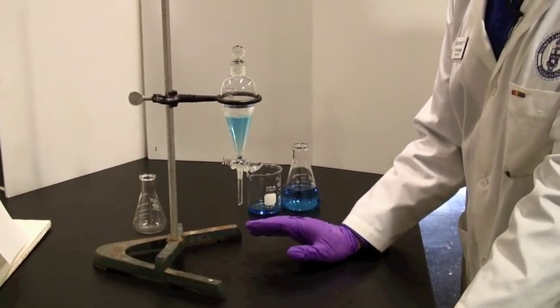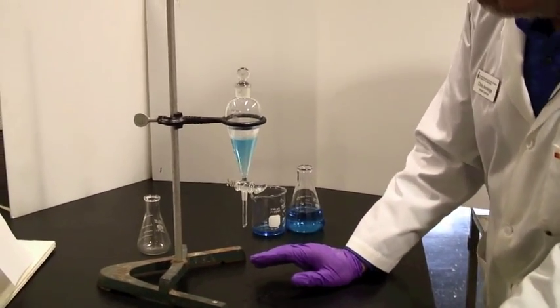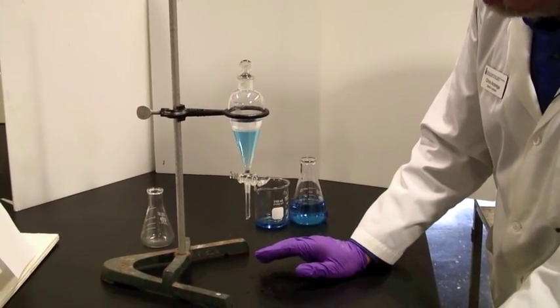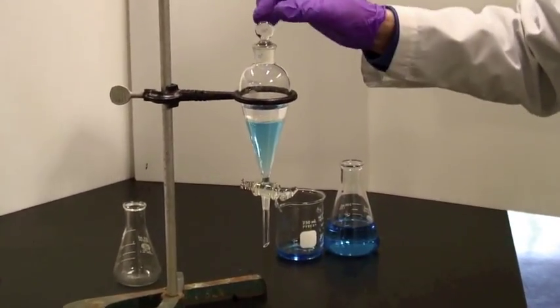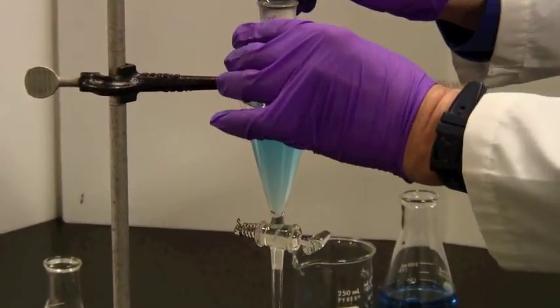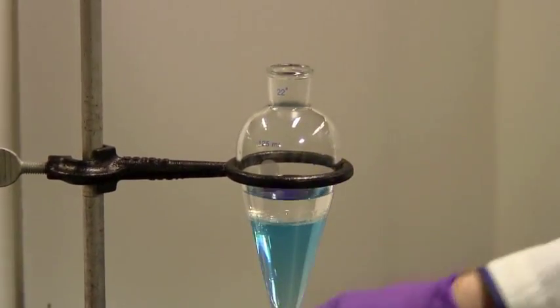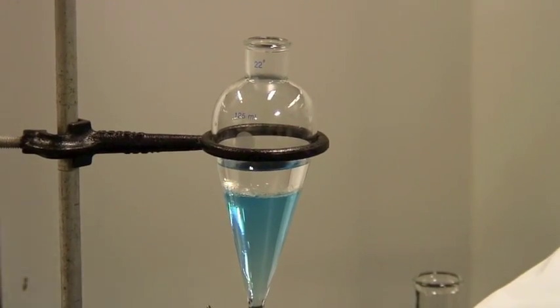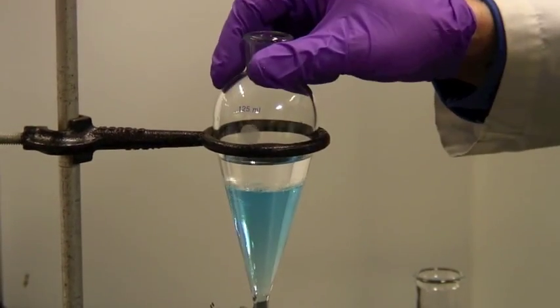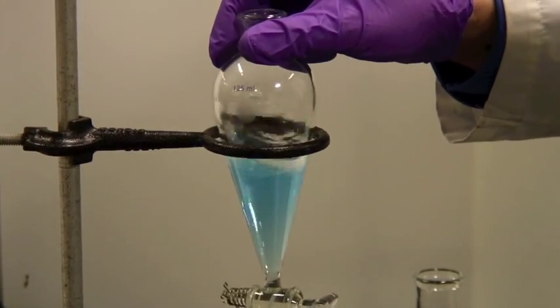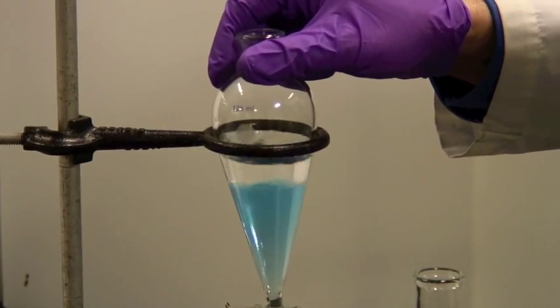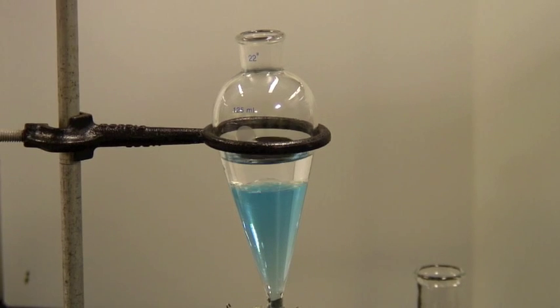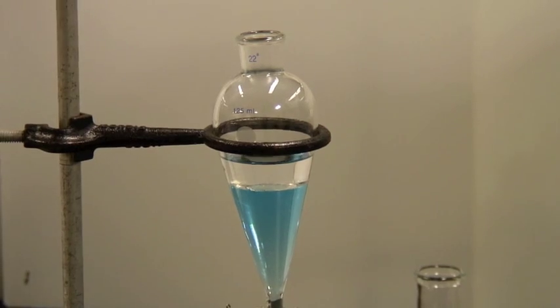If you shake too hard, you'll get an emulsion. It'll take a long time to settle. This one is actually coming out fairly nicely. It'll be ready in a few minutes. Again, don't forget to take the cap off before you try draining or there will be sadness afoot. Sometimes just some gentle swirling like that will get the bubbles to collapse and give you a decent clean interface.